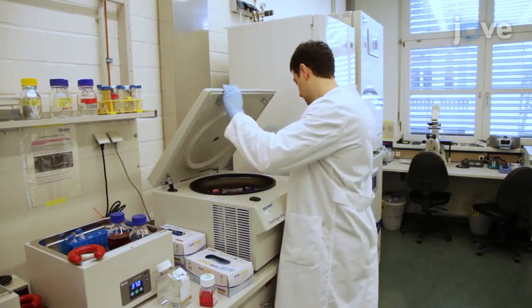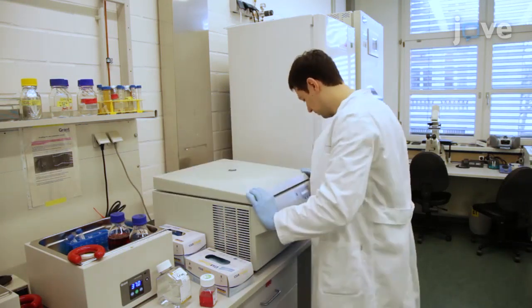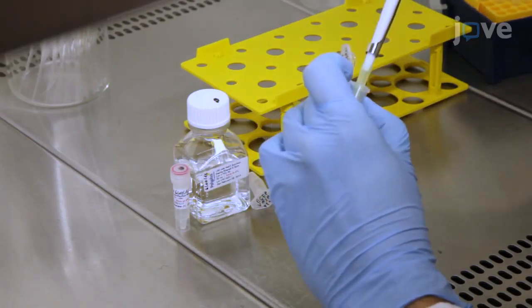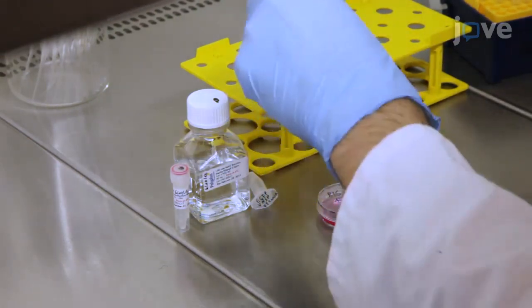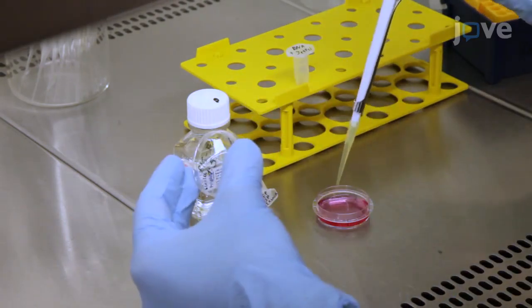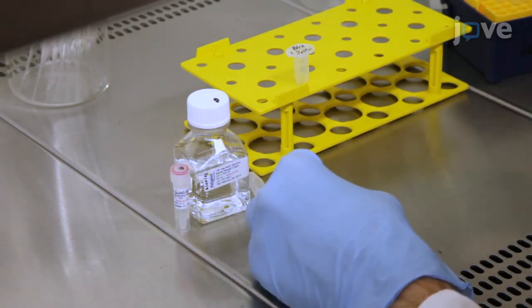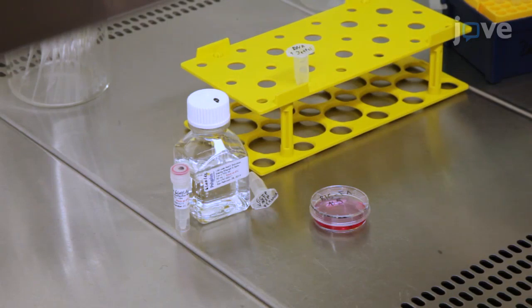After this, centrifuge at 1,000 RPM for 3 to 5 minutes. After seeding the B16F1 cells into a 3 cm dish and allowing them to spread for at least 6 hours, transfect the B16F1 cells by adding a mixture of 500 ng of DNA construct and 1 µL of transfection reagent in a solution containing 150 mM sodium chloride.